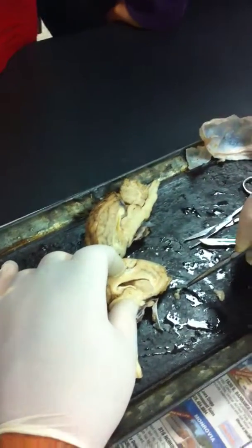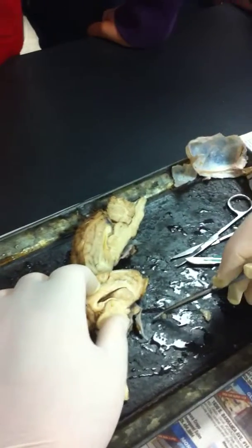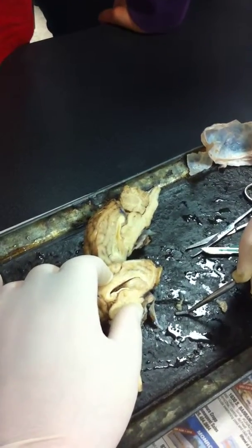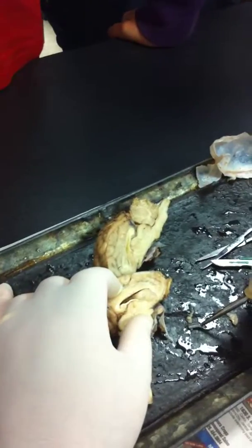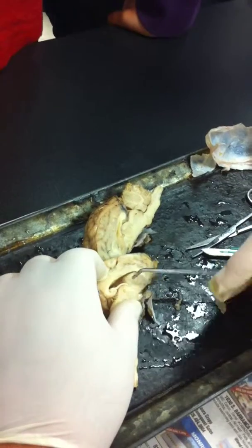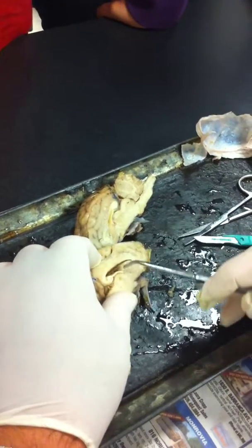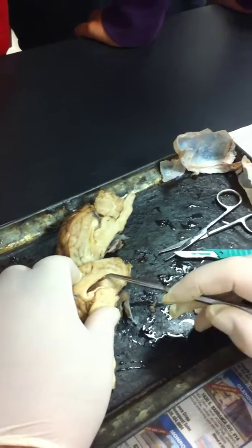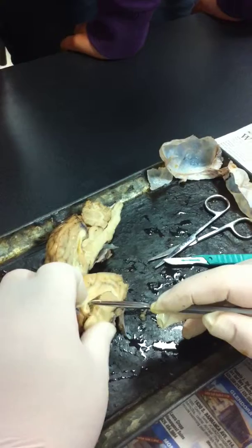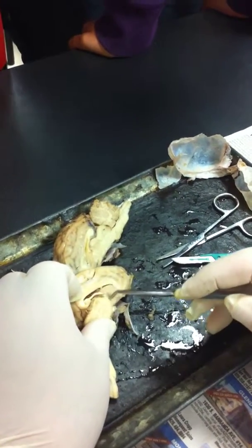What are the structures in the ventricles? The choroid plexus. Yeah, choroid plexus. Why is it brownish? What is it? Blood. Yeah, it's blood. Capillaries. That's what the choroid plexus is. It's just a network of capillaries. So this is a choroid plexus. See that? Lateral ventricle. And you can see more. This is more choroid plexus.